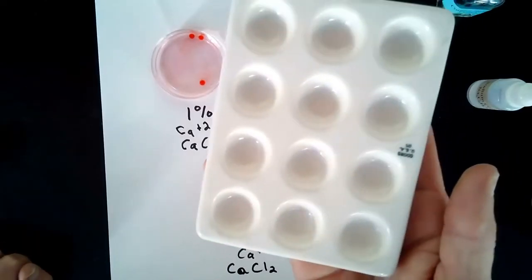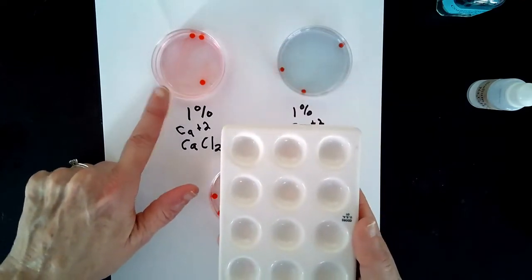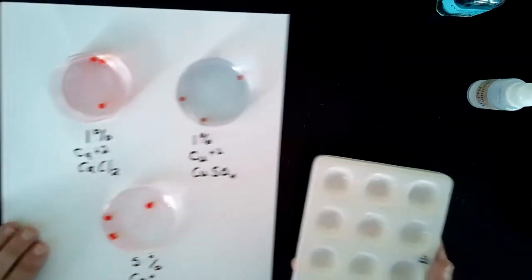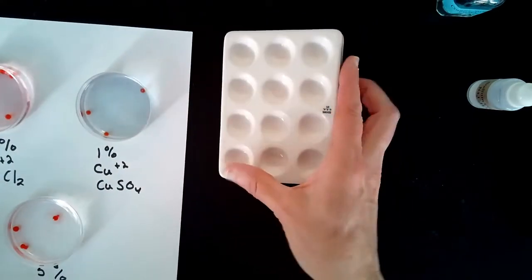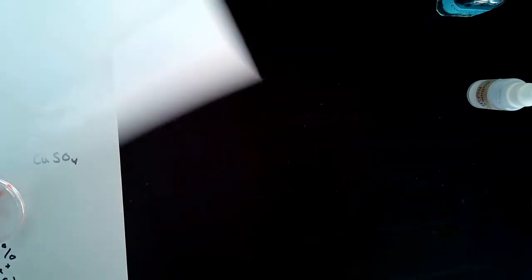This is a spot plate and then you will be transferring the beads from the solution. You'll put the beads into the spot plates. Just like it's important to label so you know what beads you've created with what solutions, it's important to label your spot plate.